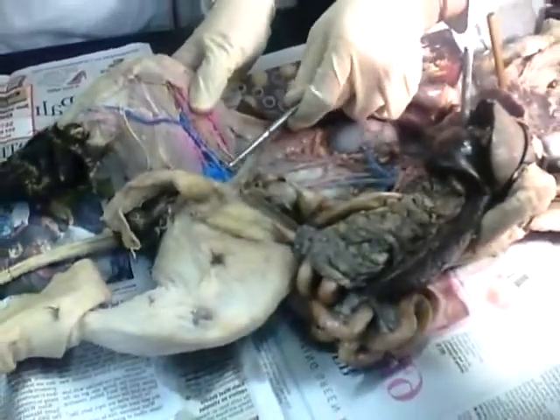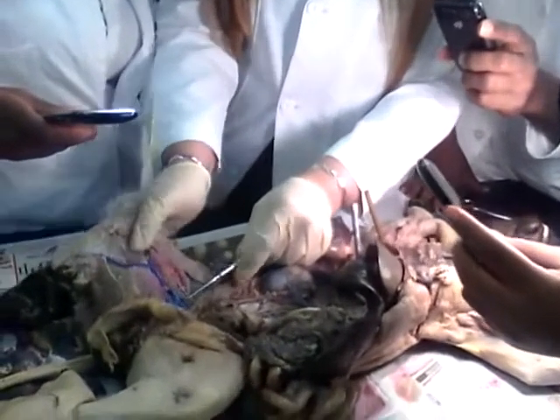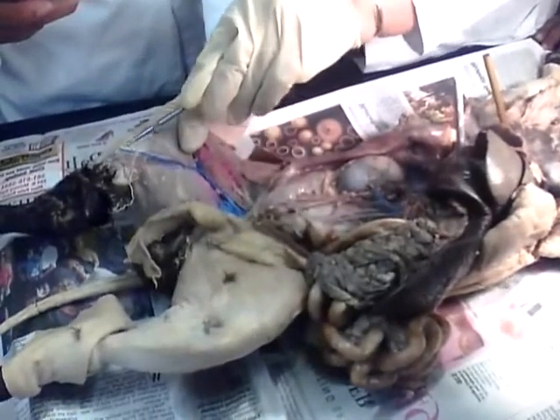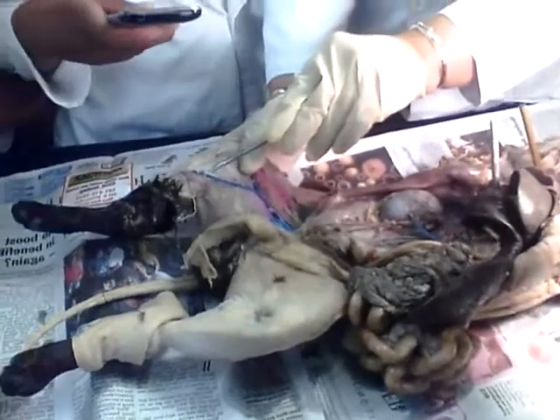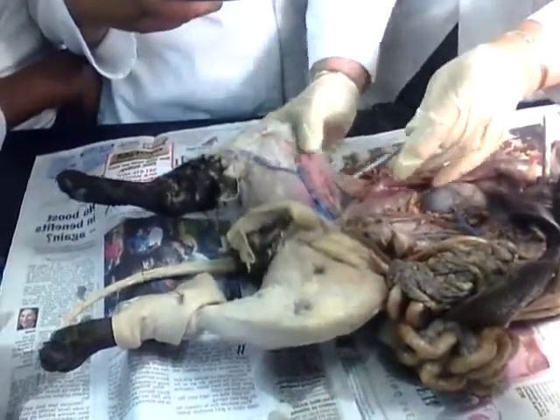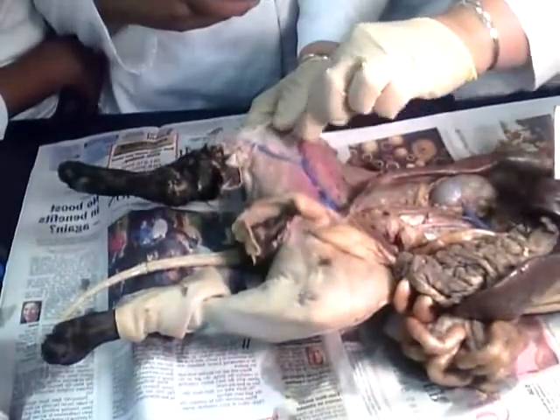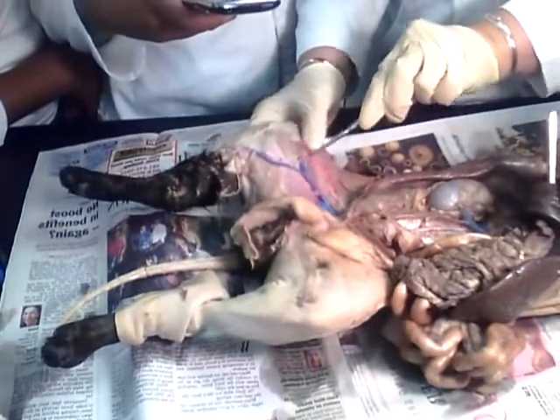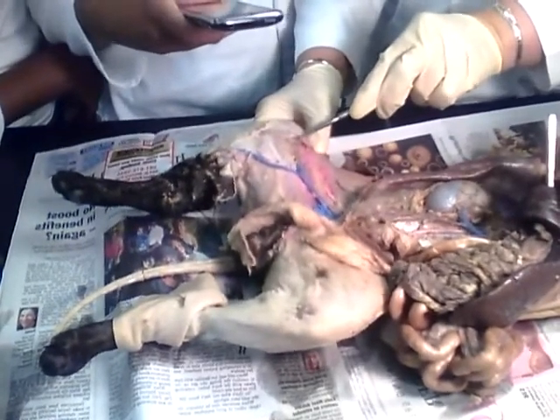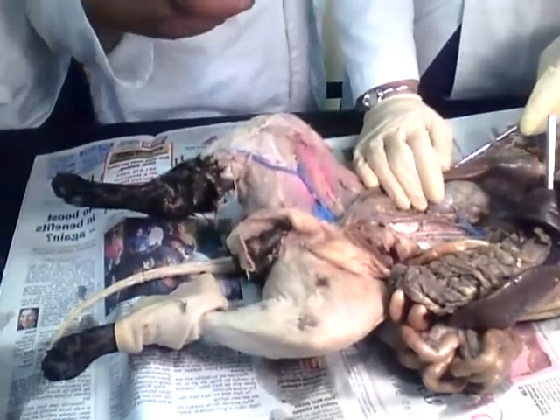Femoral. This is the femoral artery, right? We're going to have the deep femoral. Then we're going to follow it through all the interior of the leg, and it's going to be called the saphenous. Remember, this big artery goes all the way. Then it's going to go deep behind the knee, and it's going to be called popliteal. And then on top of the knee it's going to be called superior articular.